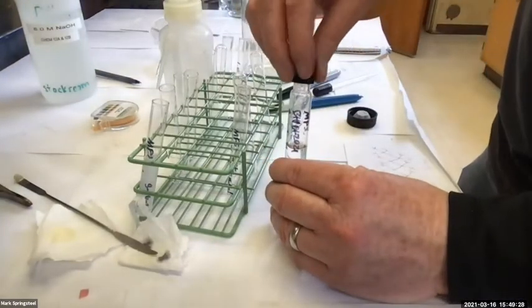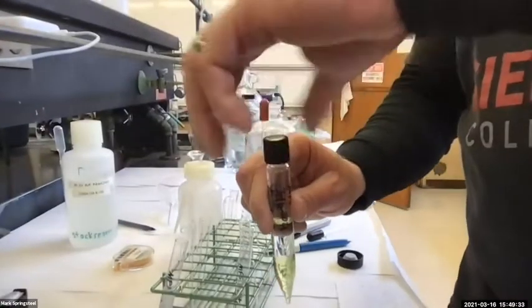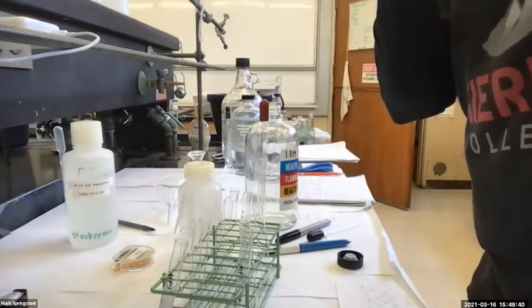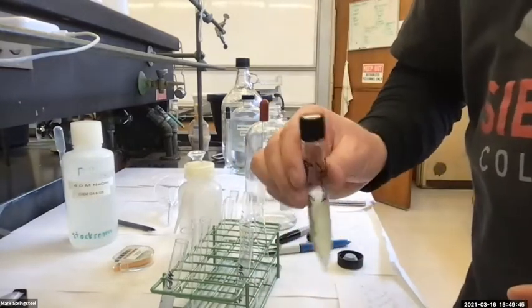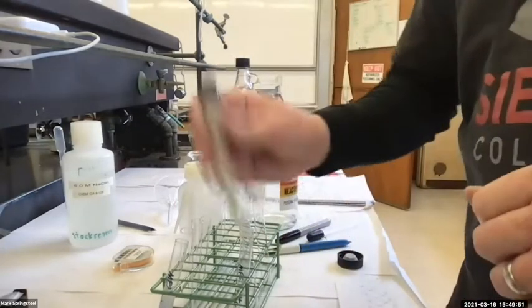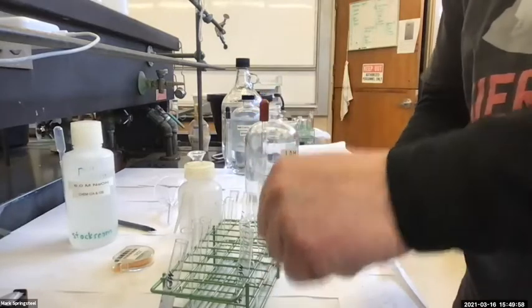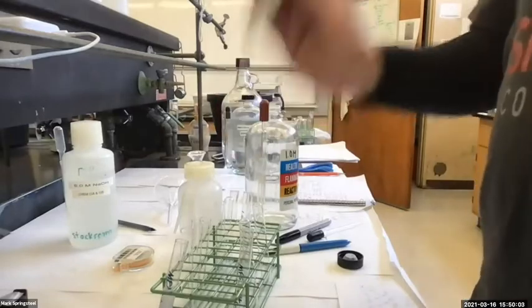And again, it's not going to react well currently because it's only reacting at the surface. So if I cap it, I don't want to give a vigorous shake right away. I want to just give a short shake. I'm going to actually give it two of these so maybe you guys can hear the vent. Let's see if you can hear it. It was too light. I held it next to my AirPods, but now I can give it a little more of a shake. Vent, more of a shake. Vent. Keep venting. Okay, now I feel pretty confident. It's not giving me a lot of problems with the venting.